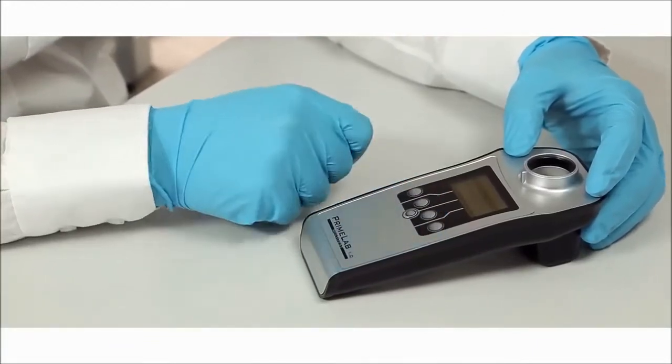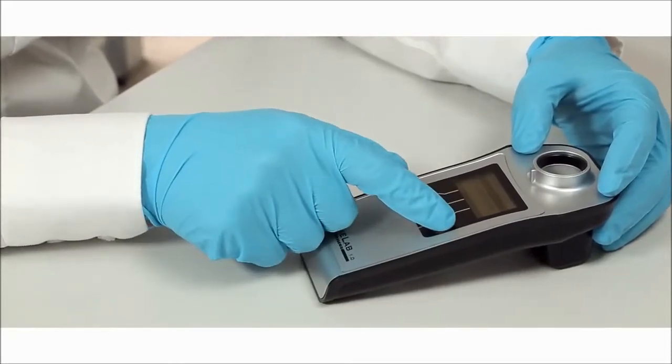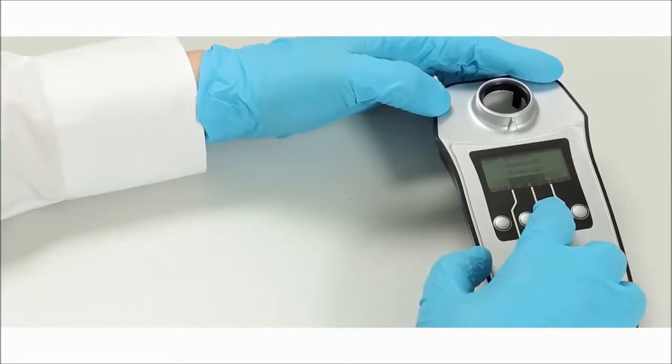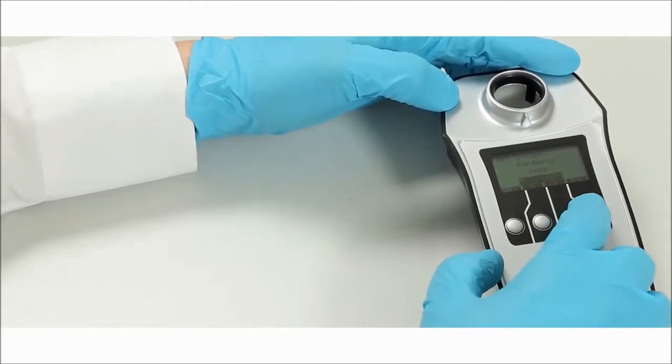Here you can use the up and down arrows to choose the account you wish to use and click OK. Choose your test and begin to follow the test instructions using the down arrow.